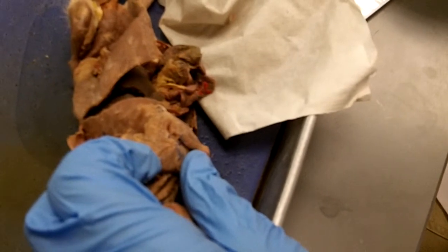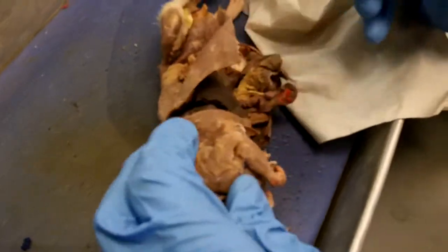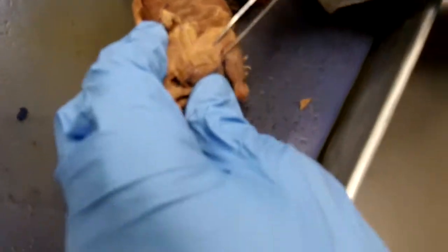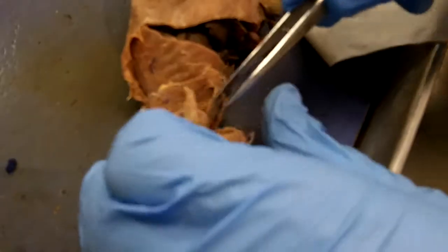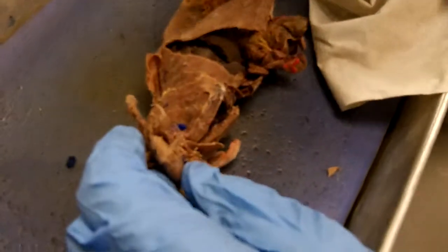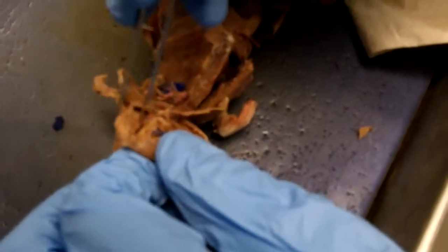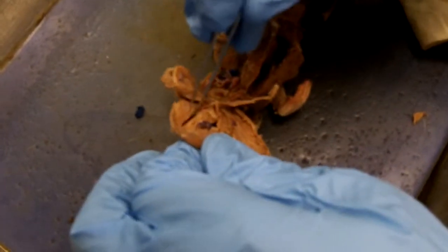These are the nerve. Okay, so you're right. Are those both the triceps, the lateral head and the long head? The lateral head is like this, and the long head is like that, and the long head comes around on the back side. So we have to say lateral head or long head of triceps. That's also the long head of triceps. So it goes all the way around on the medial surface there.